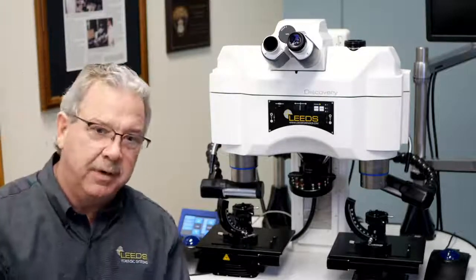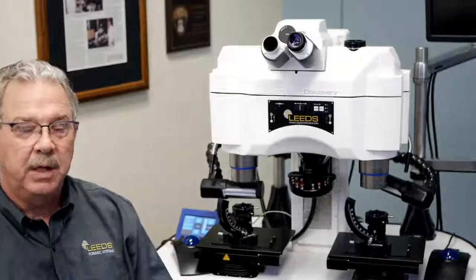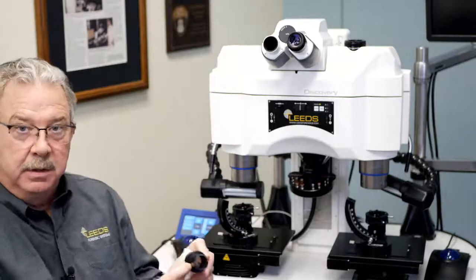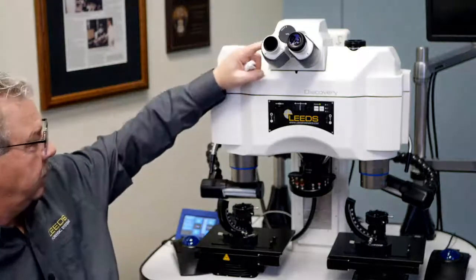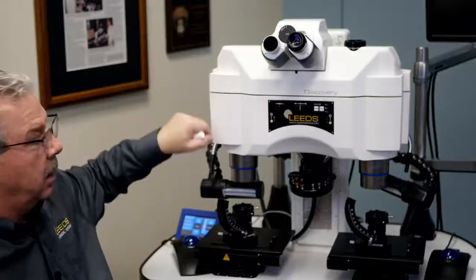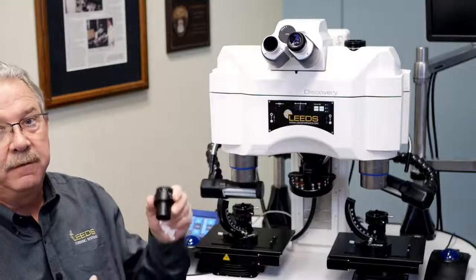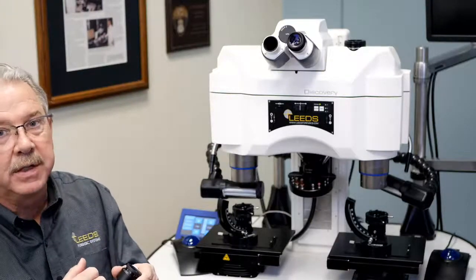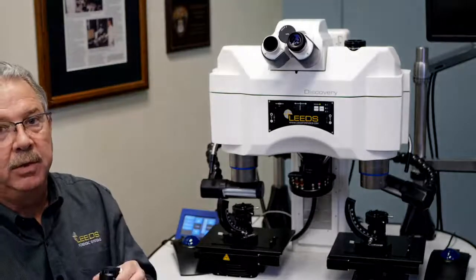But here's the part I have a hard time wrapping my head around. I can put an 18 millimeter field of view eyepiece in here, and that means there's an 18 millimeter size ring in there. And I'm going to see, when I'm at 10x total magnification, I got 1x coming through the microscope at that point, and I'm going to divide by the magnification that lies below that field stop to determine the area that I'm actually viewing through the eyepiece.